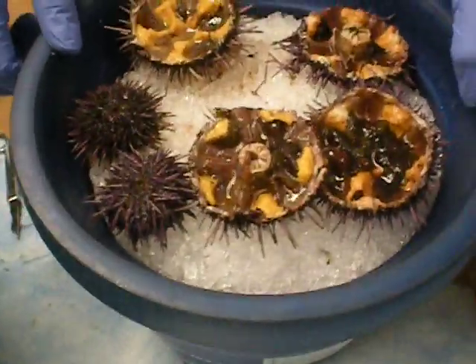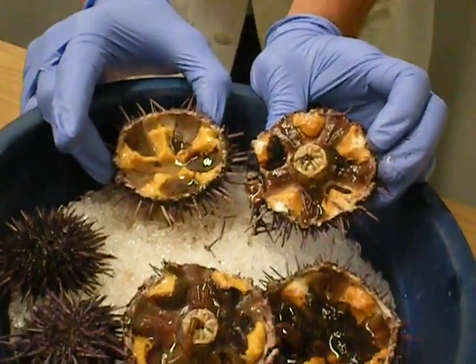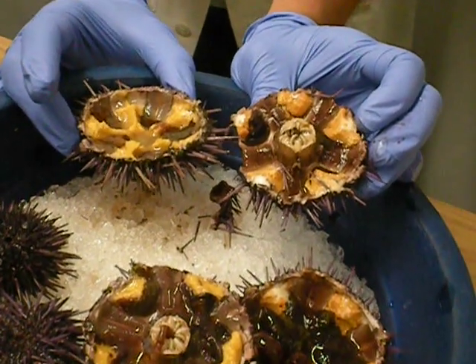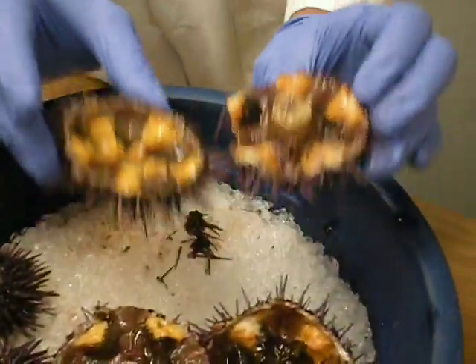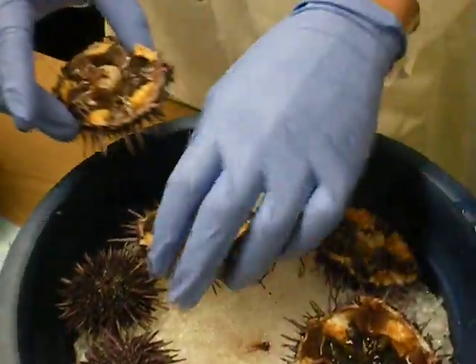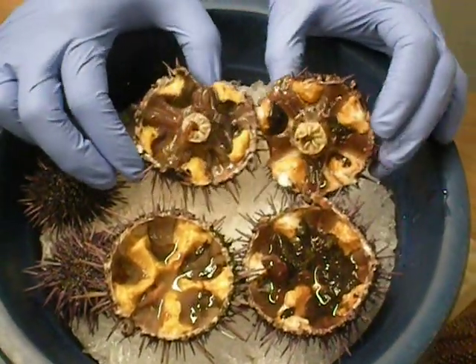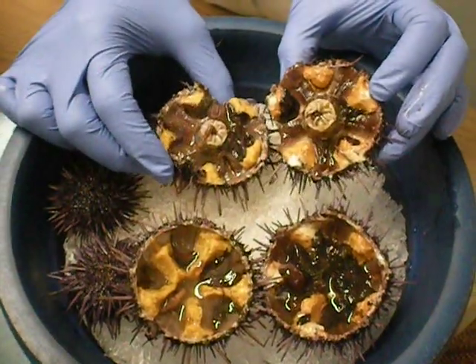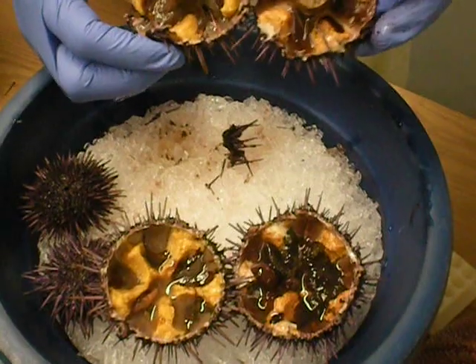So, can you tell the difference between the male and the female? No. The female has, like, it goes further in the middle. That's a good observation. The middle standing part isn't as tall? I think that's just because it was smaller. But I was told that you cannot tell the difference between the male and the female unless you can see it's secreting eggs or sperm. So if the sperm wasn't here, they're both the same thing technically, right? Yeah.